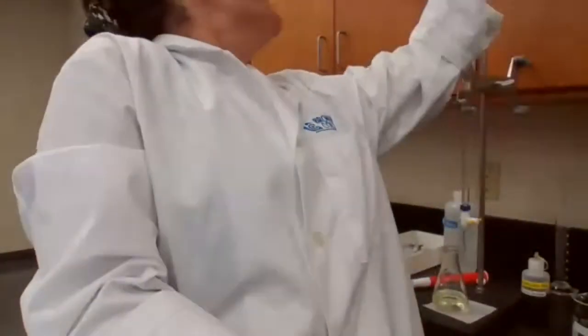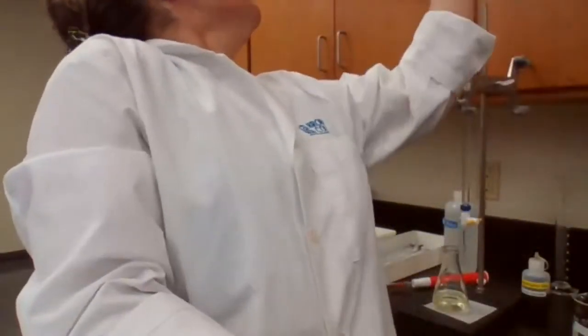I'm sorry. The 10 milliliter, yes, it went from 4 to 14. Coincidentally it was the same, because I took 10 milliliter of calcium hydroxide and I used 10 milliliter.